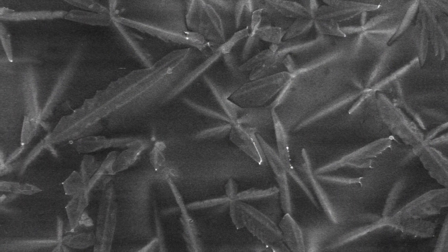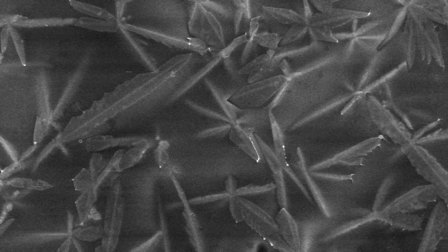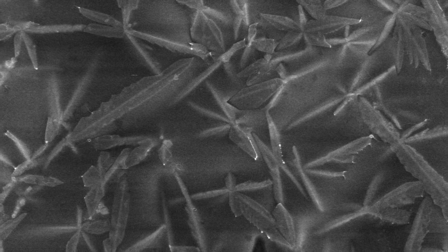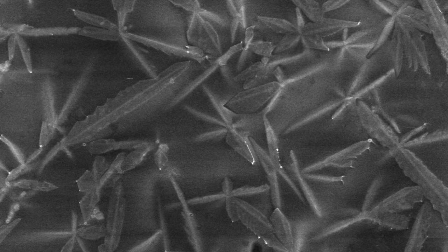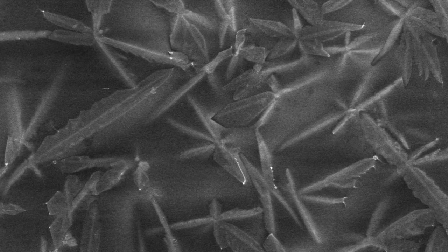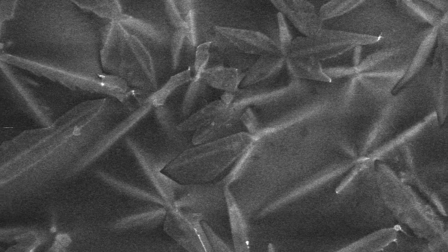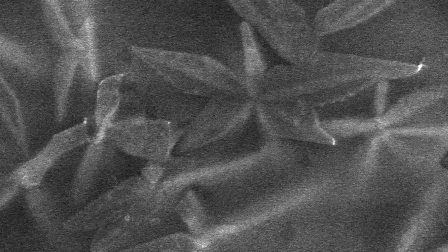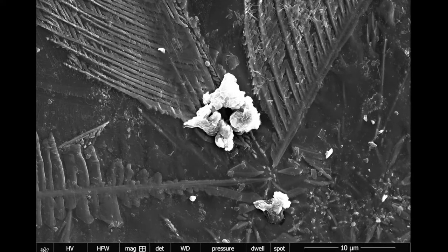But what I'm speculating with this image is that as I'm ball milling my rocks to produce the glaze materials, the rhyolite itself is ball milling and weathering down and getting really fine, but the topaz crystals are basically resisting the weathering and resisting the ball milling, and they are then acting as little alumina seeds for these crystals to grow out of. And here's another image at 5,000 magnification.